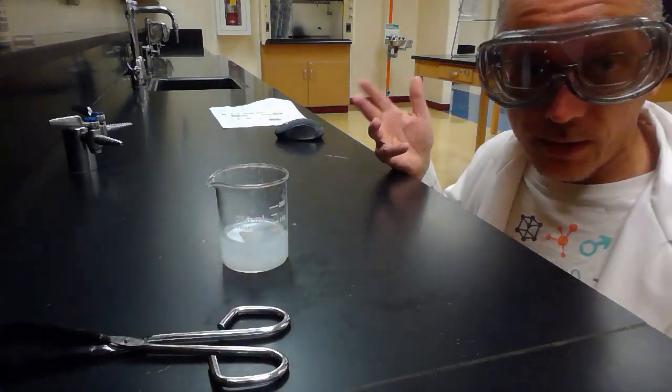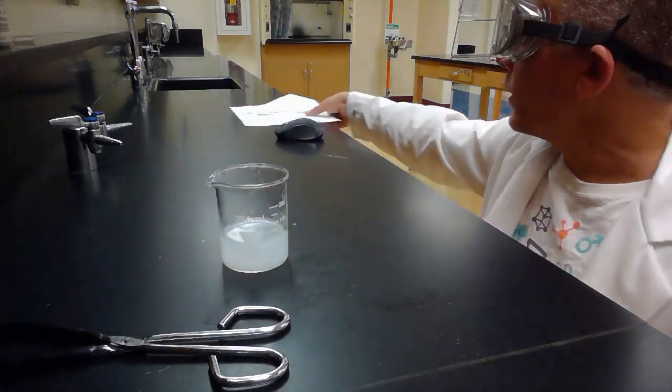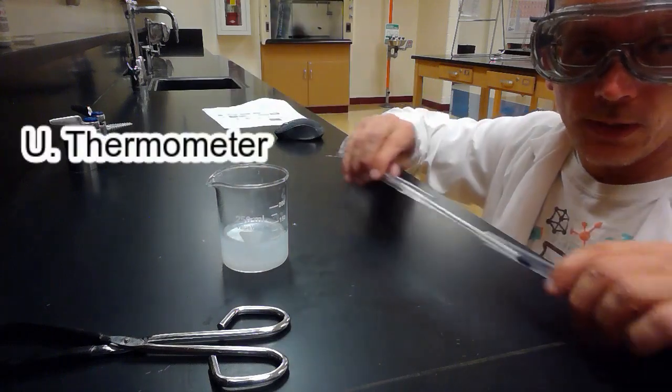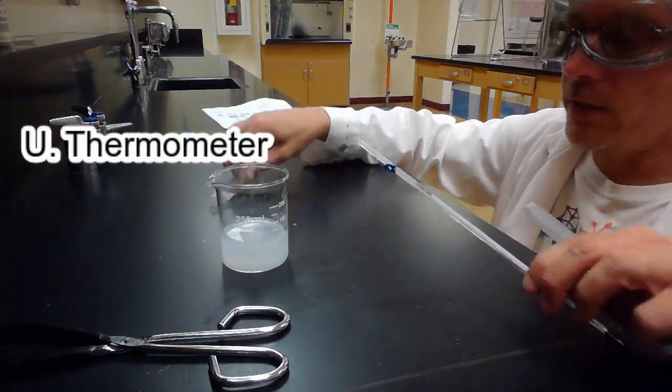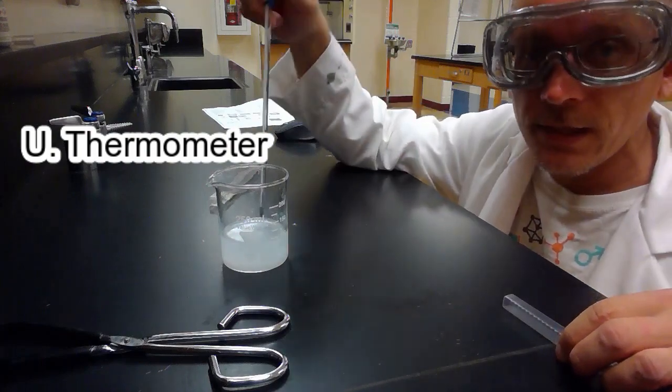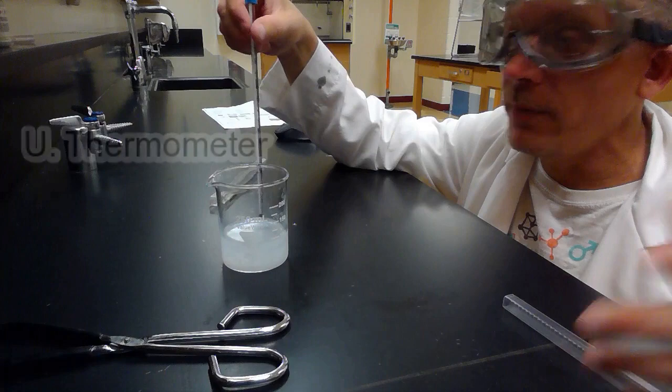Maybe I want to know what its temperature is now, so I'm going to use picture U. Picture U is the thermometer. You remember from last time, the thermometer comes in a case. Make sure you take it out of the case, and then we can put it in our liquid and measure its temperature.